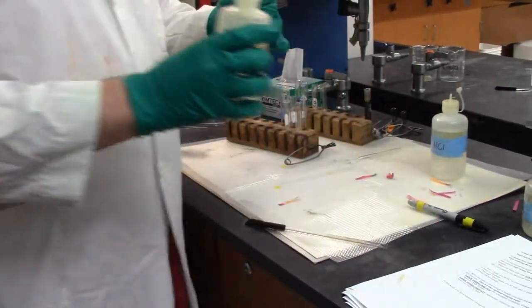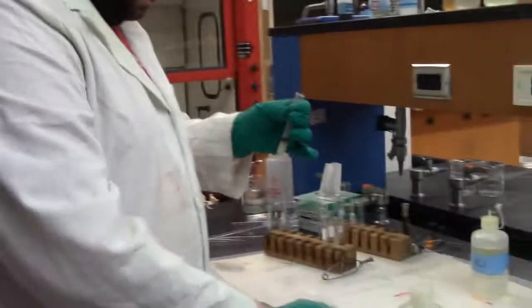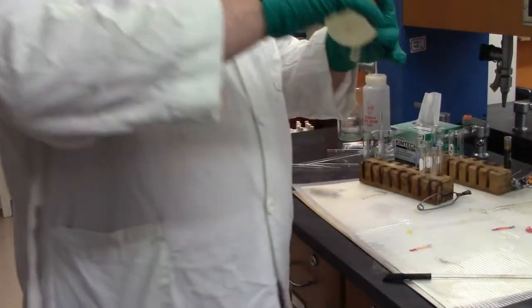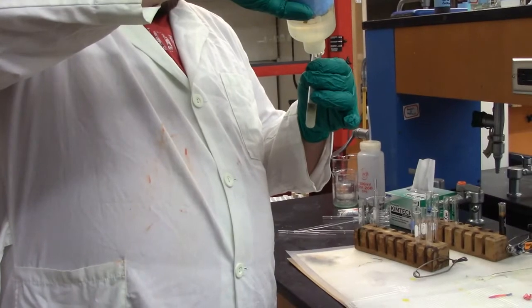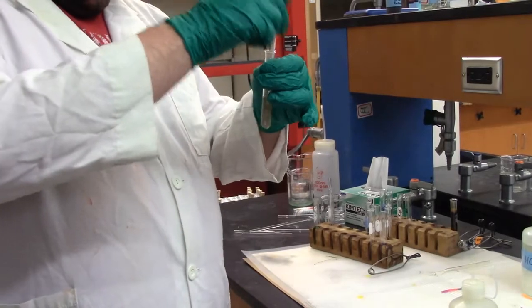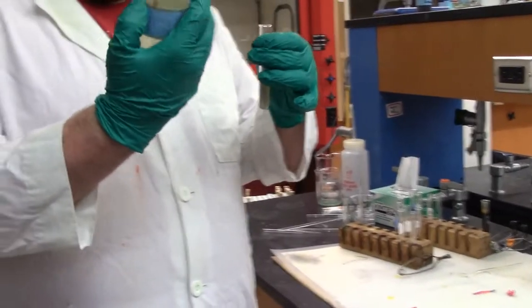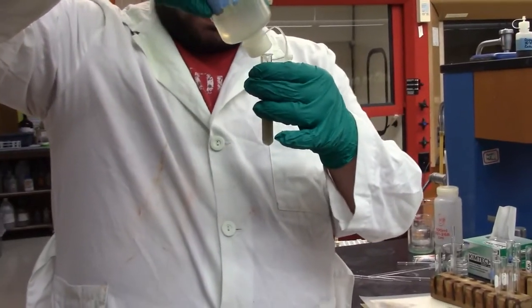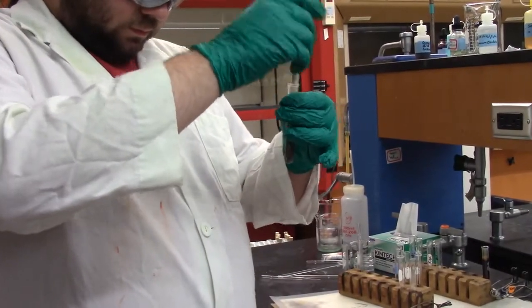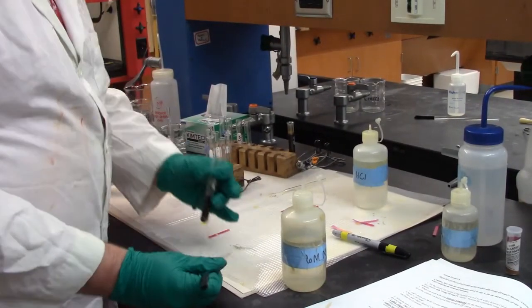Nope, that is in fact still acidic. So, add some more. Still acidic. How are we doing? Still acidic. Yeah, this thing's taking its sweet time. Let's add a bit more. Let's use this one. Hey, there we go. Ding, ding, ding.